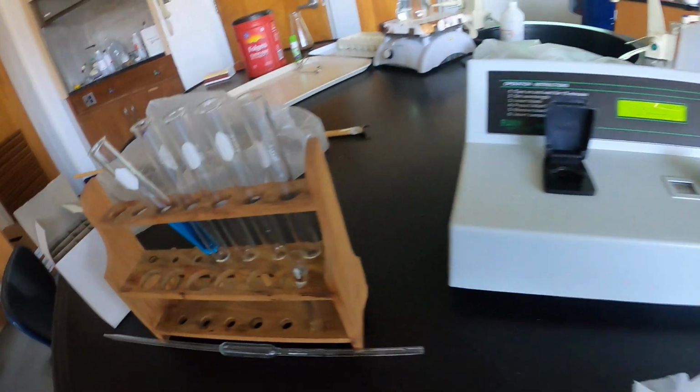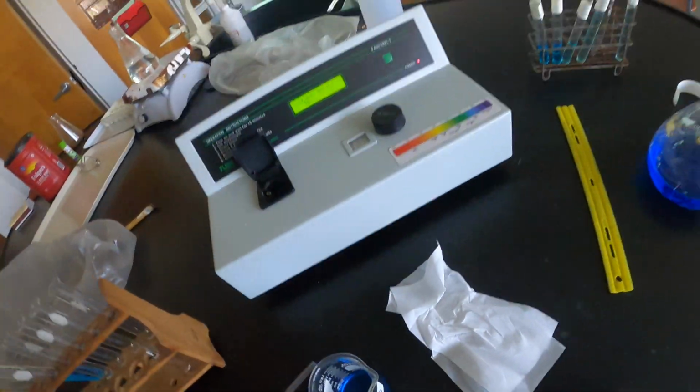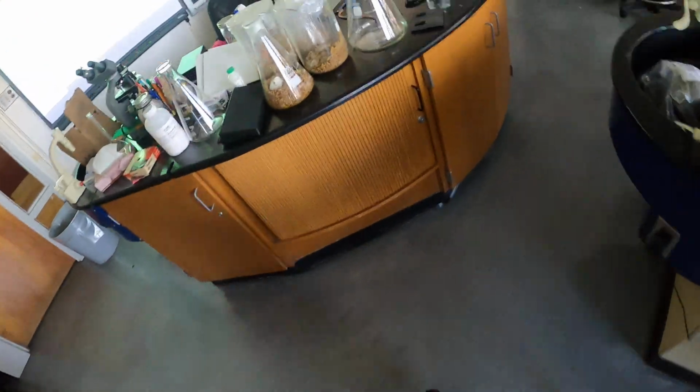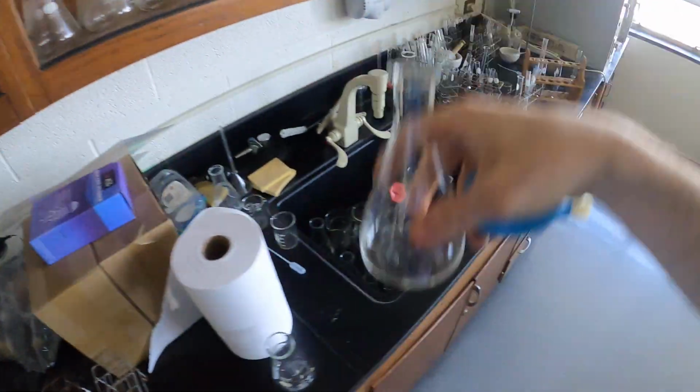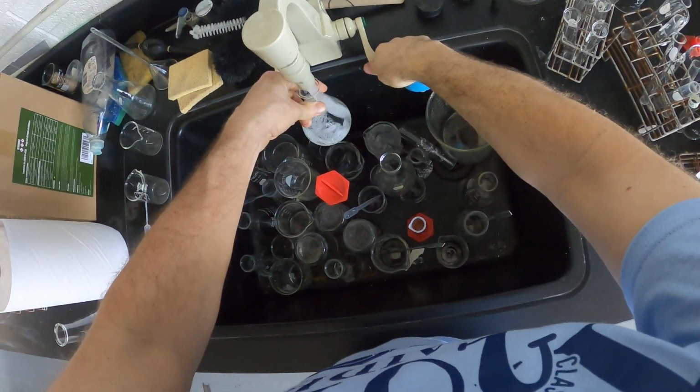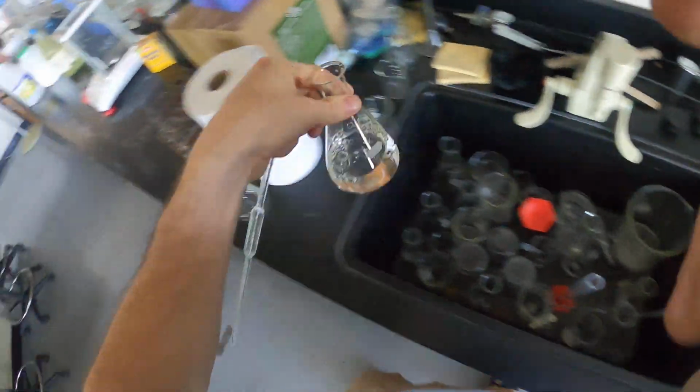Okay, I'm going to dilute that in half by adding to it 10 ml of water, which I'll grab. Doesn't matter whether it's tap or distilled. Our water doesn't have a color, thankfully. So distilled, non-distilled, doesn't matter.